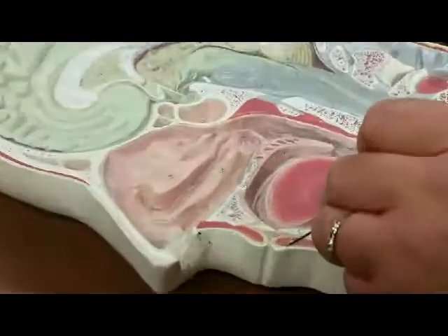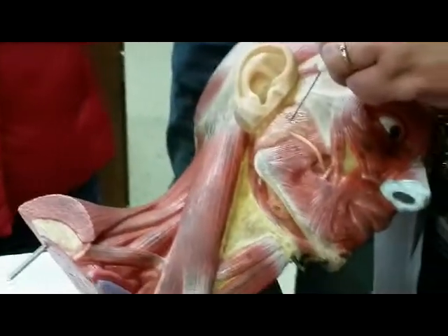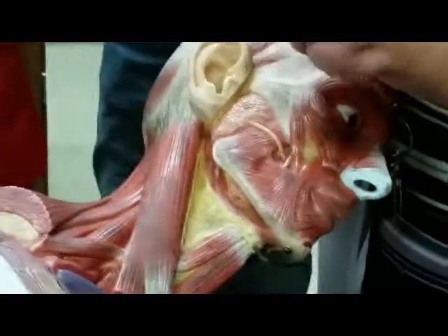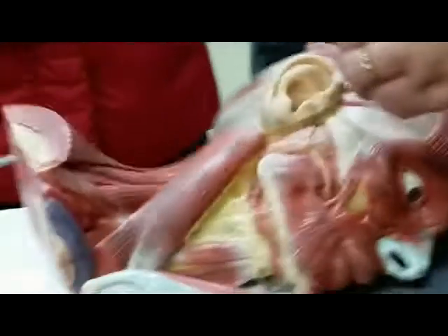Lower lip, or lower labia. And then they ask us to point out now the salivary glands, and only one. In the lecture we mentioned a picture. So this is the parotid gland that lies right behind the masseter in front of the ear. That's the only one they ask us to point out, the parotid gland.